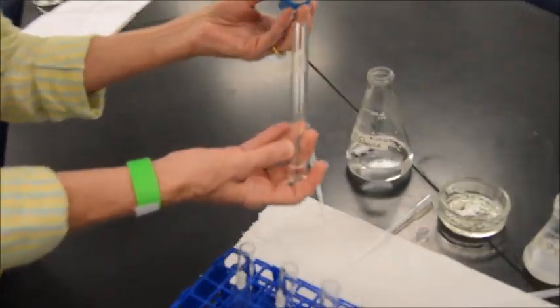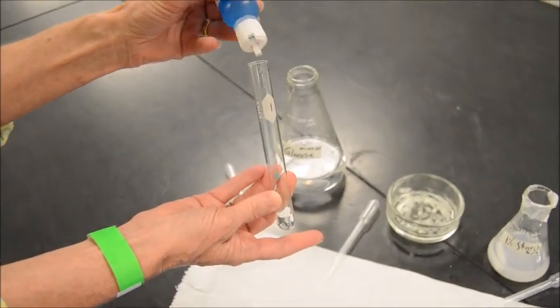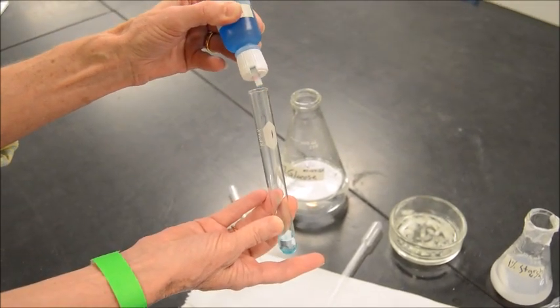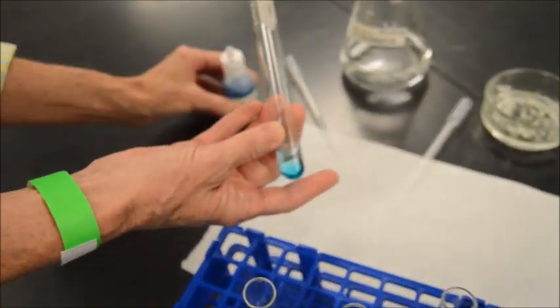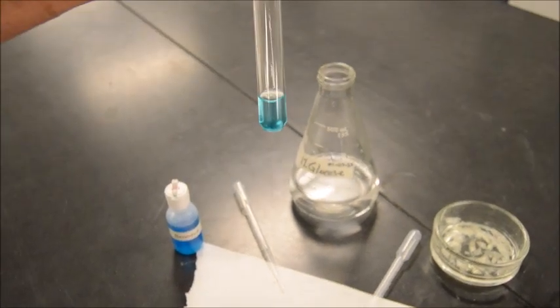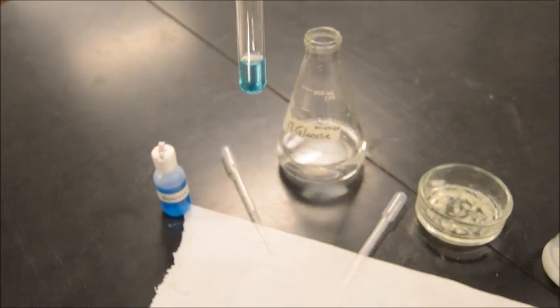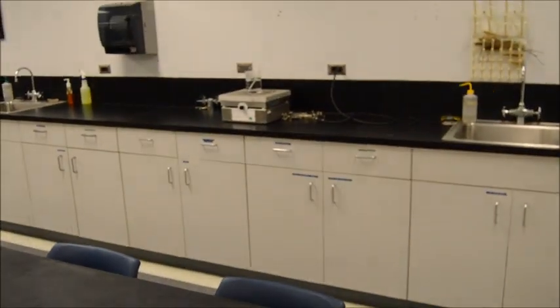Okay, which is blue in color, so let's see what it looks like. Turquoise blue. So we're going to go 1, 2, 3, 4, 5, 6, 7, 8, 9, 10. This is dropping fast today. Let's take a look-see. Okay. It's got this nice, very pretty color to it. Yes, indeed. So we're going to put that one down, and then we're going to get the rest of them set up, and then we're going to look at it in the hot water bath.